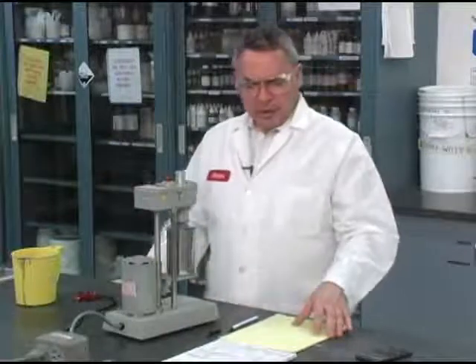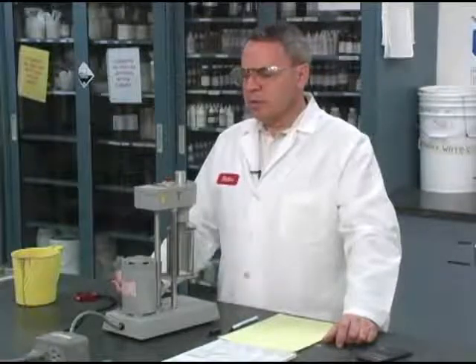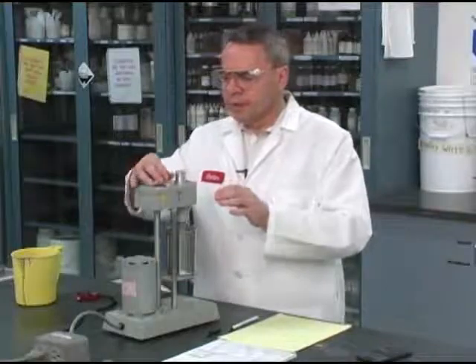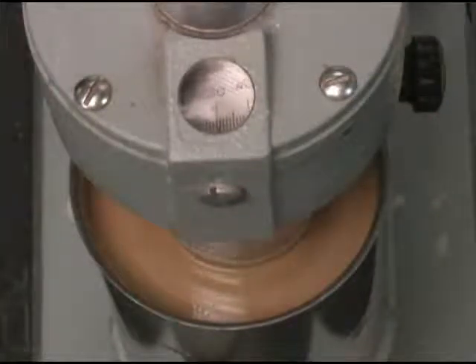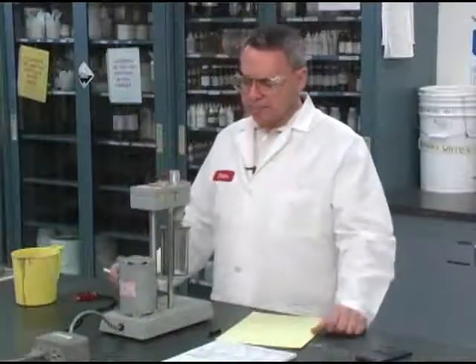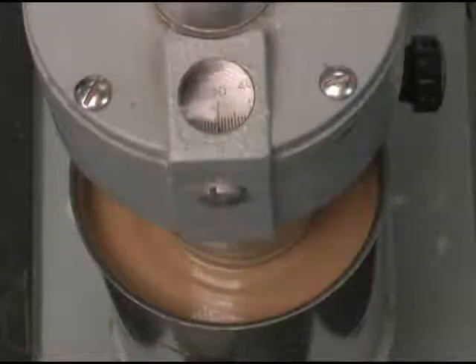Now, given the fact that we are going to be using a sophisticated model of Herschel-Bulkley, we need some more reference points. So I'm going to go ahead now and measure 200 RPM. I'm going to go to the upper gear here and go to high. So here I have 200 RPM. Wait for the dial to stabilize. And it's clear to me that the reading comes to 30.